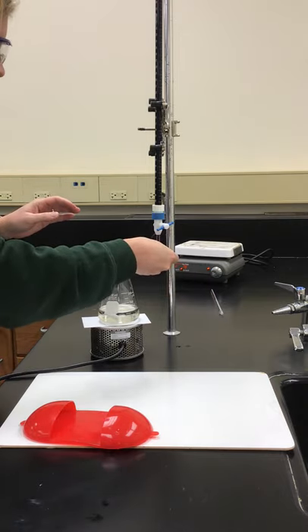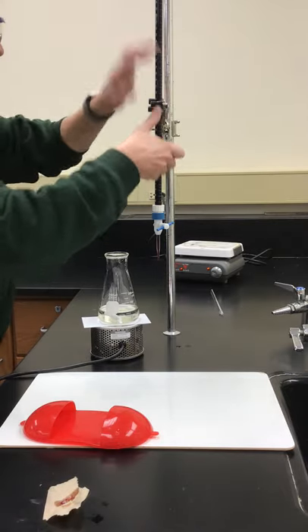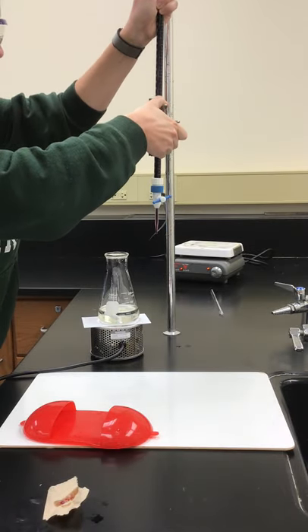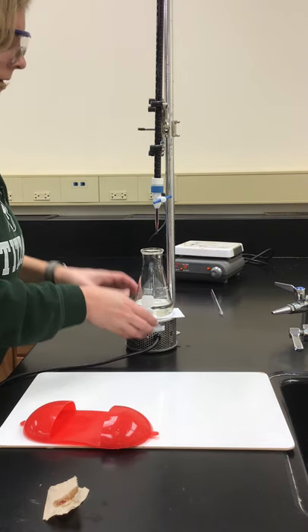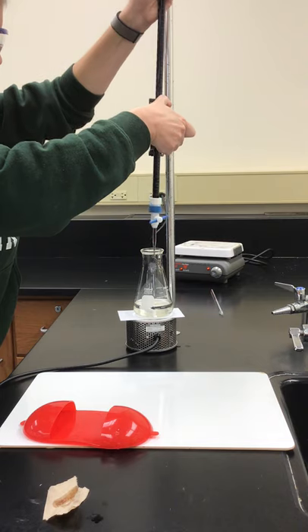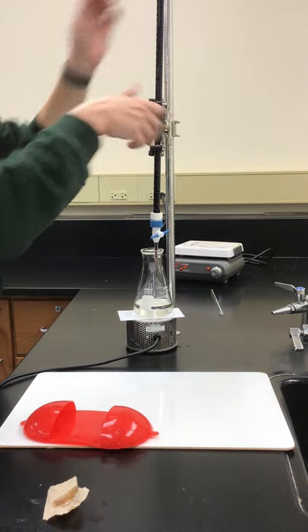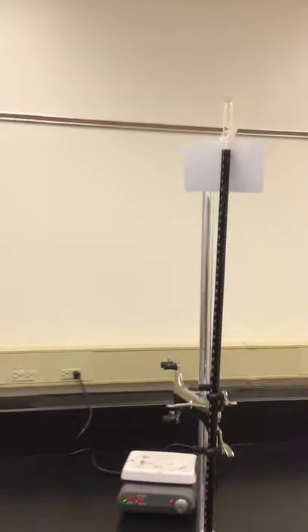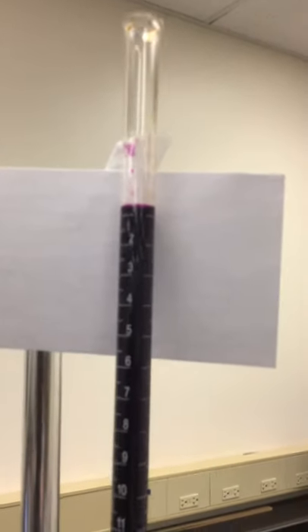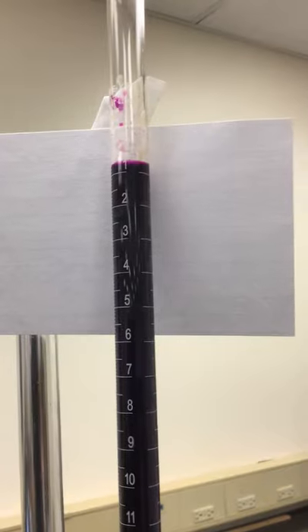I'll catch this little drop that's hanging off the bottom here before we get started. I already took note of what my initial volume in my burette was, so I'm just going to bring my camera really close to that for you guys so you can see. Now I'm going to back up one more time.